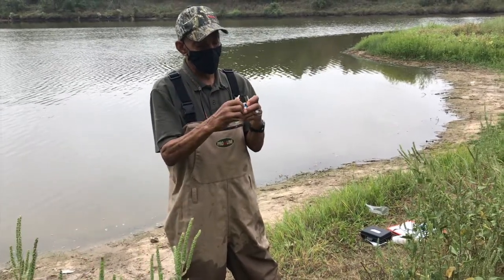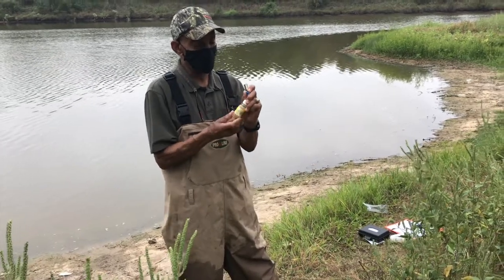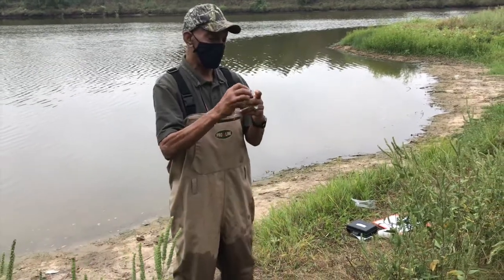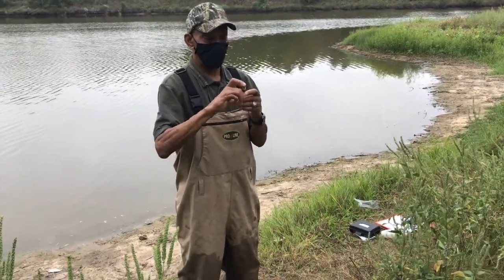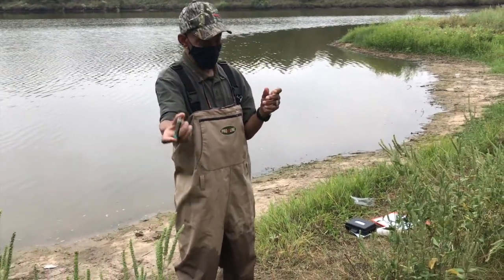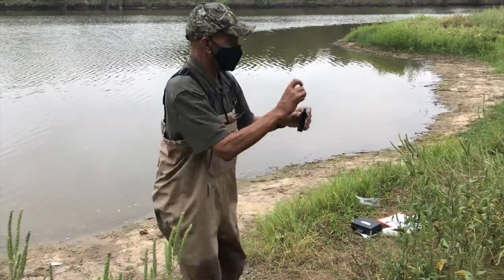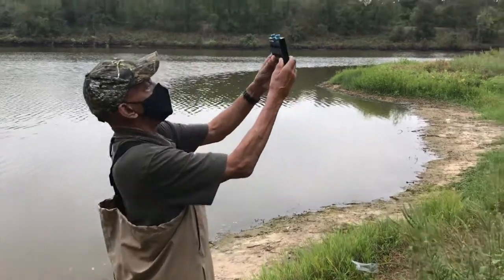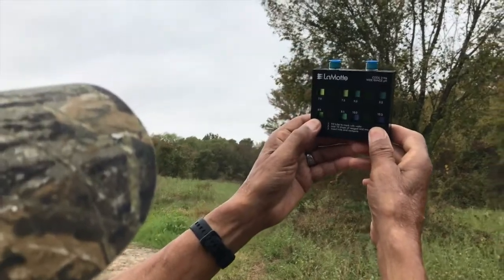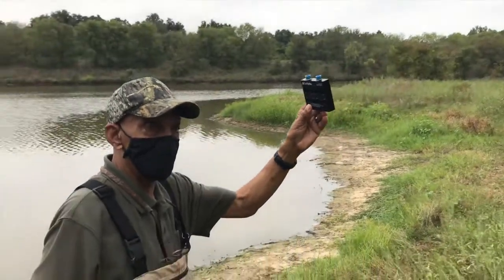All right, going to recap the reagent. Always do that to avoid any kind of spills. Put the cap in. Invert it several times to mix it. Wow, same color. So definitely our reading is on the alkaline side.